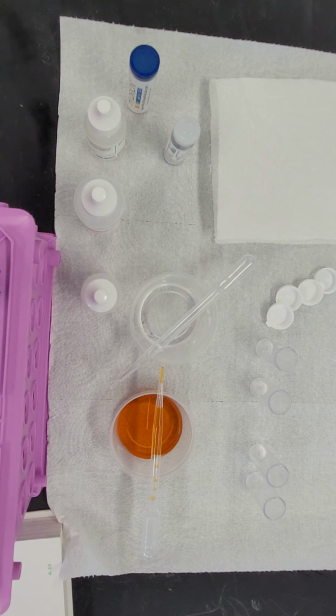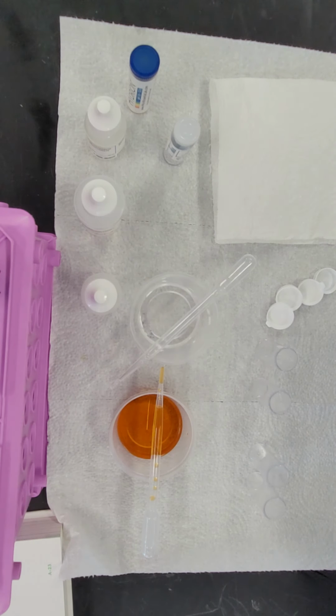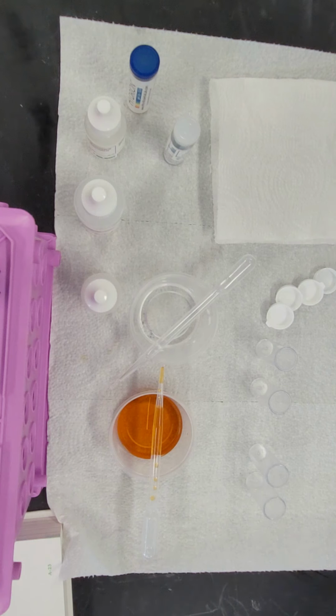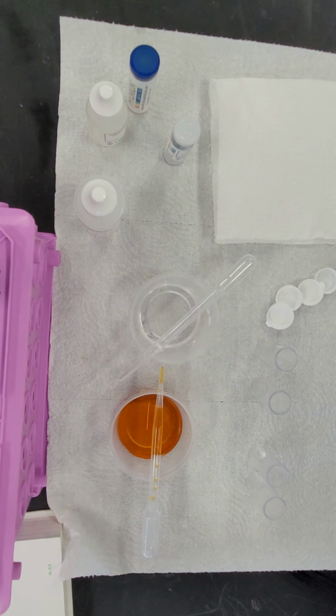So we're going to get started with the miscibility test. For those of you who don't know what miscibility is, it's the ability of something to mix with something else. If something mixes and blends uniformly, it is miscible. If it is unable to be mixed, it is not miscible. An example of something that is not miscible is Italian salad dressing. You can shake it all you want, but the oil is always going to separate from the vinegar. So let's take a look at the first test.